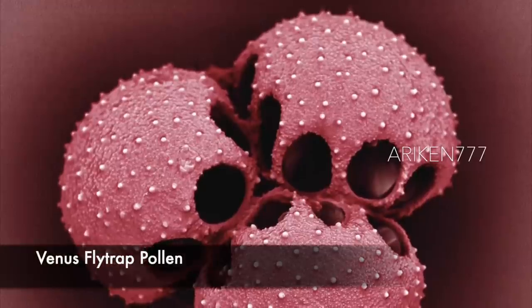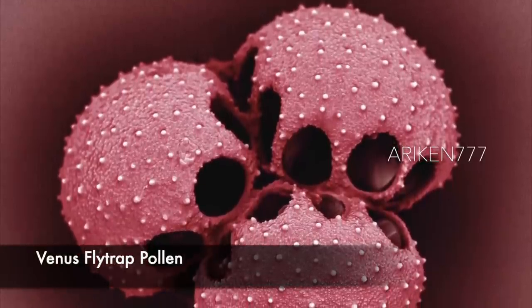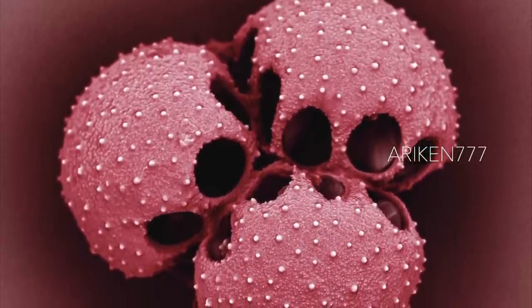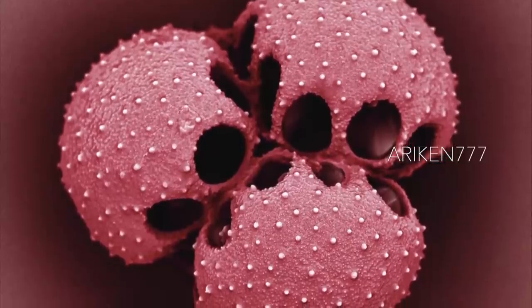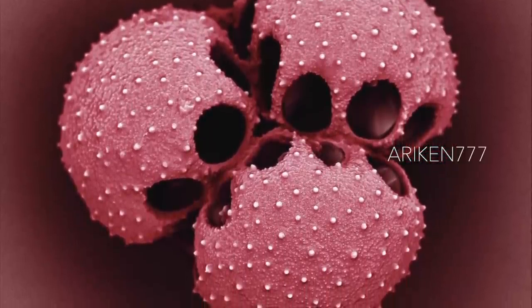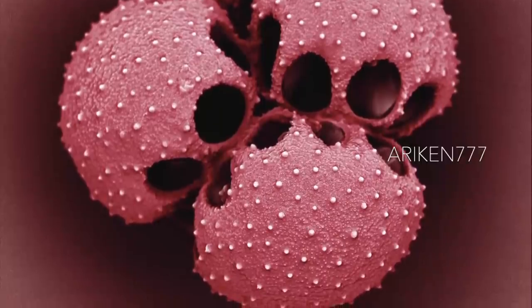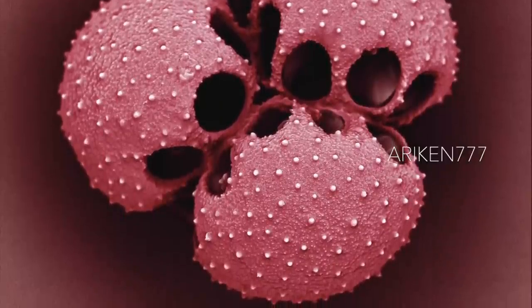Pollen grains of a Venus flytrap. Pollen grains containing the male sex cells are reproductive structures produced by the male parts of flowering plants. The structure shown here is the hard outer casing called exine that protects the gametes during transit between flowers.